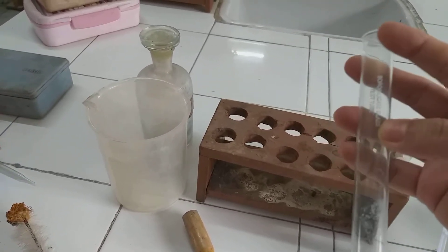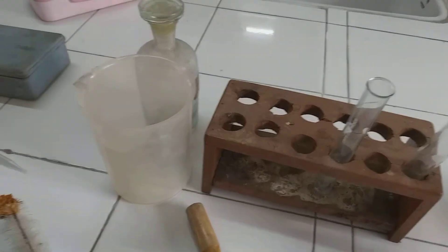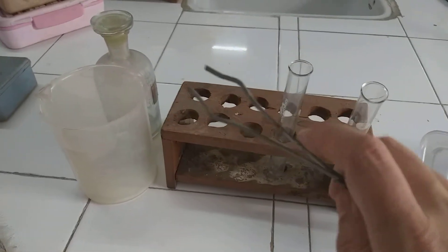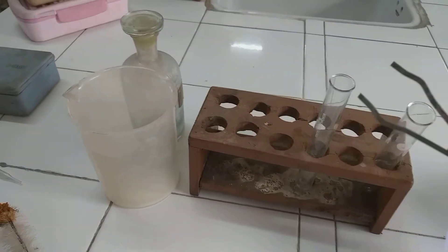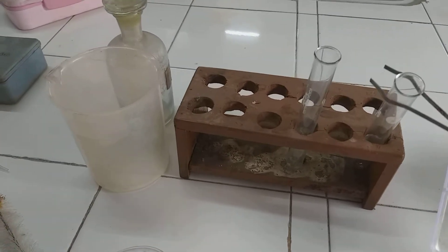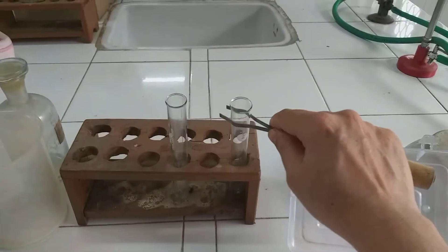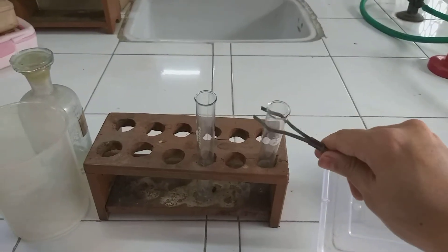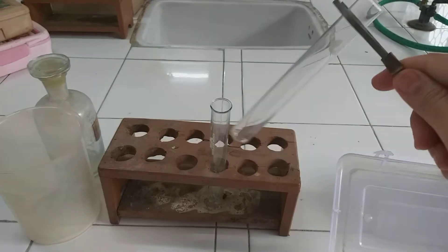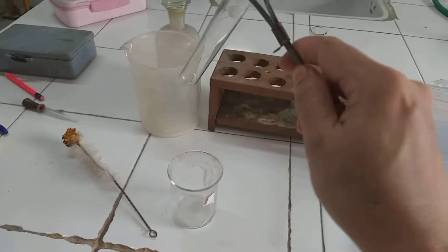This is called a test tube holder. When we are heating a test tube, we just hold it with this holder like this, and then we heat the test tube. So this is very convenient to use.